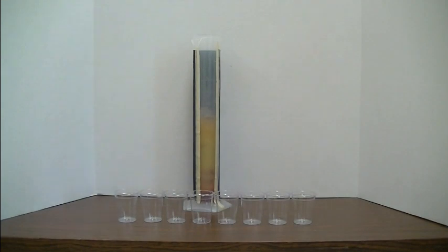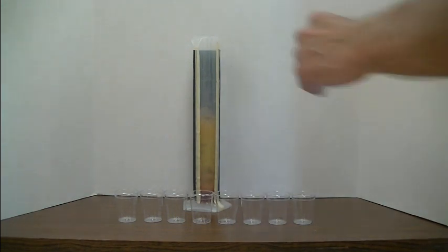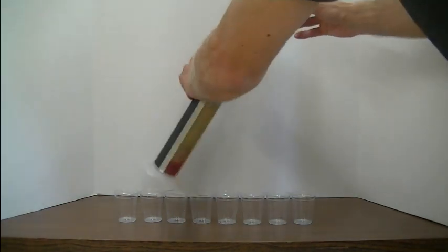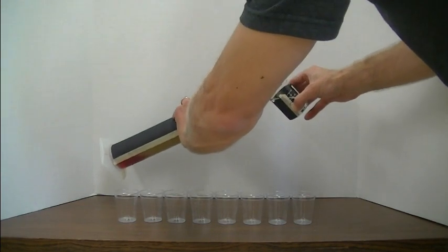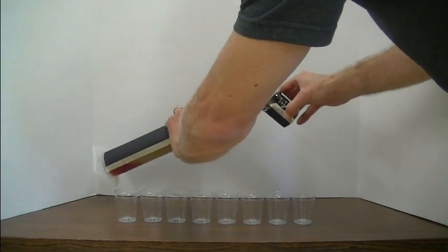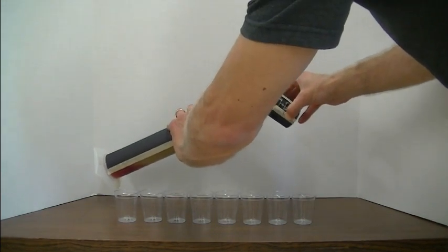Not the very top, but next, we're going to add somewhere between 50 to 75 ml of 91% isopropanol. This you don't have to be quite so careful. But I'm going to go ahead and just tilt the graduated cylinder to the side and pour in the alcohol.